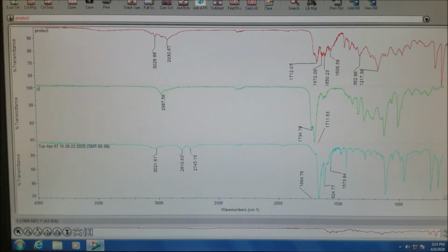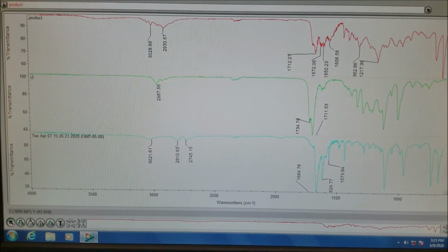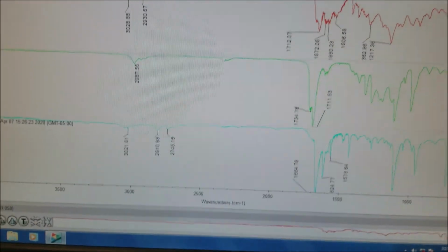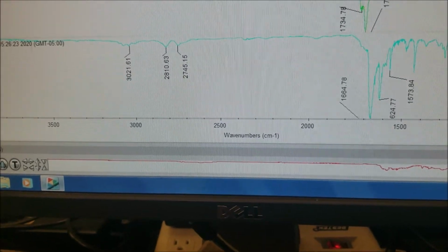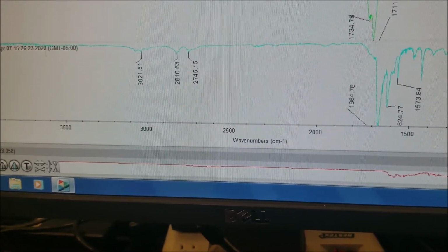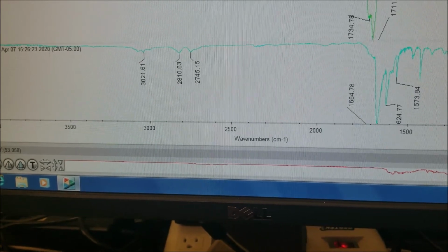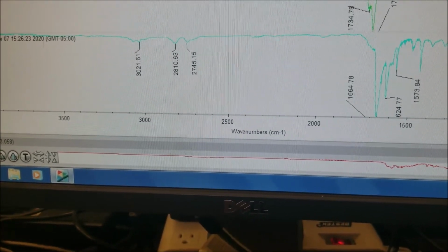So the top spectra here is our product. The bottom two: the middle one is ethyl acetoacetate, and the bottom one is trans-cinnamaldehyde. Let's look at these each individually. So the bottom one, you notice there's a peak at 3021. That is from our phenyl. Well, it's most likely from our phenyl group in our cinnamaldehyde.